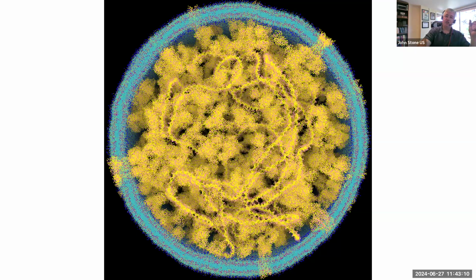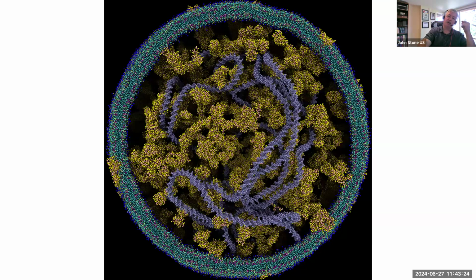If I change the shading a little bit, add a little more color, make some more selections, I go from that to this. I can start to see a little more depth there now. If I then stop drawing it as points and actually draw it as van der Waals spheres and use ambient occlusion lighting, I've done like 3 things. So this took less than 2 minutes to make, and I didn't even know the names of the particles, so knowing nothing, you can make a figure like this in a very short time.